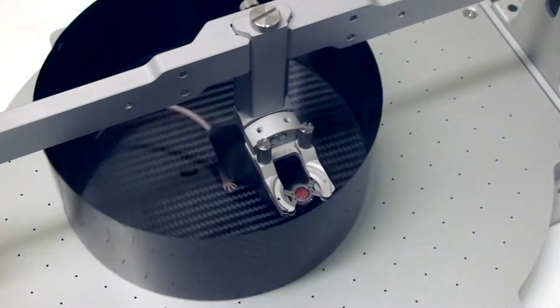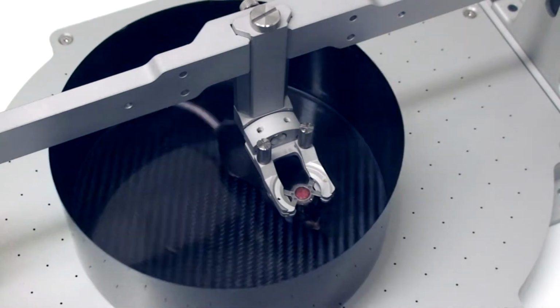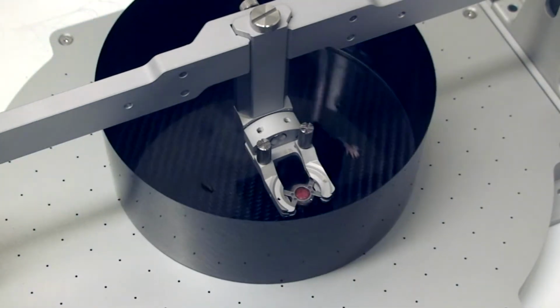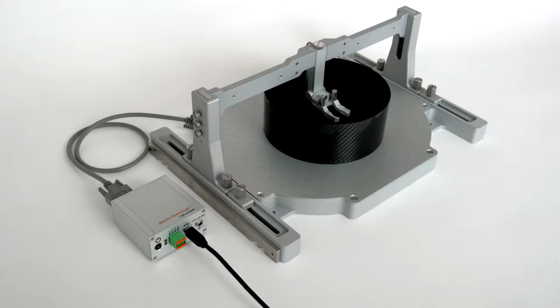Researchers used the mobile home cage for head-fixing awake mice during microscopic imaging, single-cell electrophysiology, and optogenetic stimulation. Some of them combine these techniques with simple behavioral readouts. To enable more complex behavioral analysis, we have recently added motion tracking capabilities.